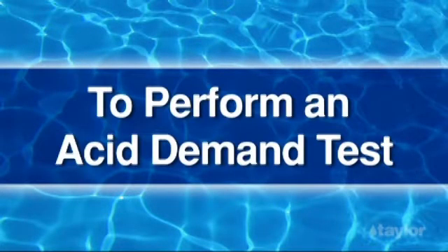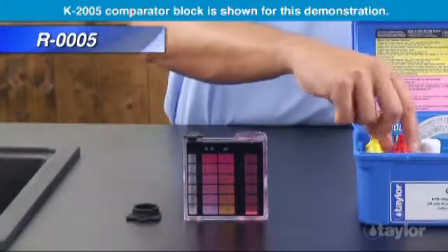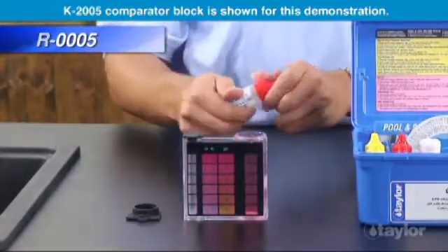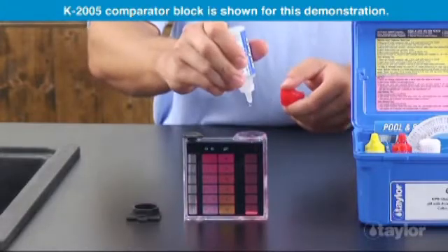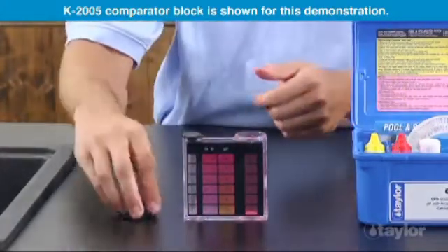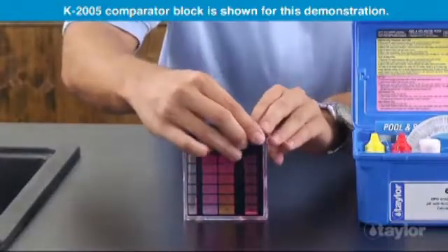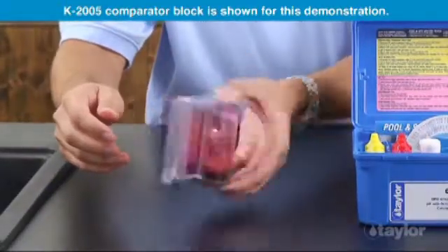To perform an acid demand test, use the treated sample from the pH test. Add reagent 5 dropwise. After each drop, count, mix, and compare with the color standards until the desired pH is matched.